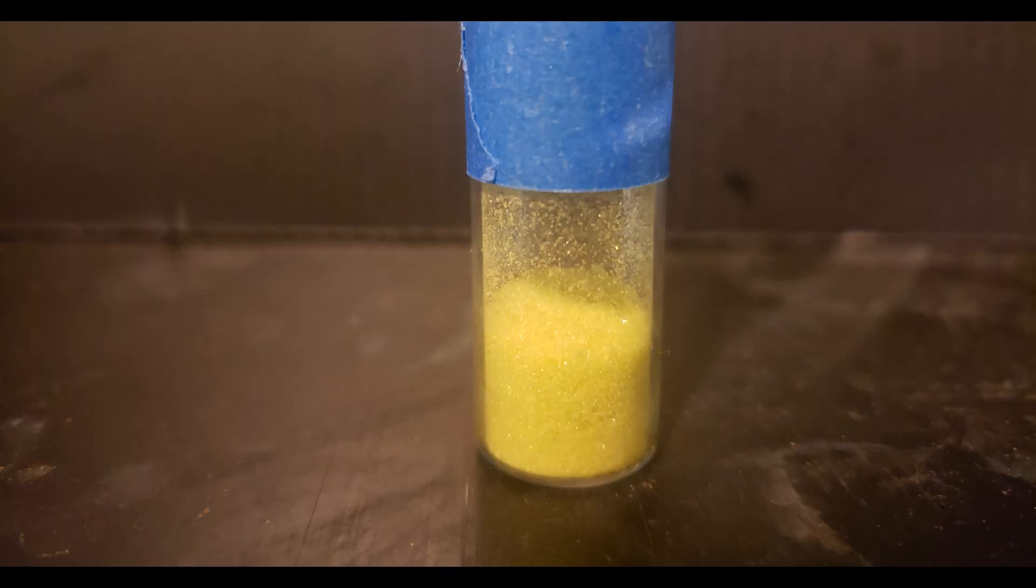After a brief drying to remove any acetone, the mass of the final product was 1.63 grams, or about 35.45% yield. Probably the reasons for the poor yield include the messy recrystallization I carried out and the fact that I did this reaction on twice the scale of the original paper.